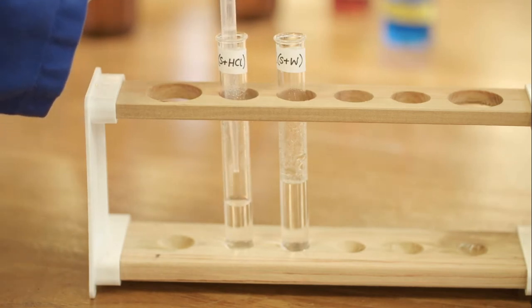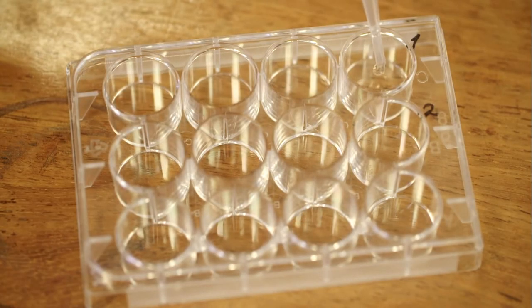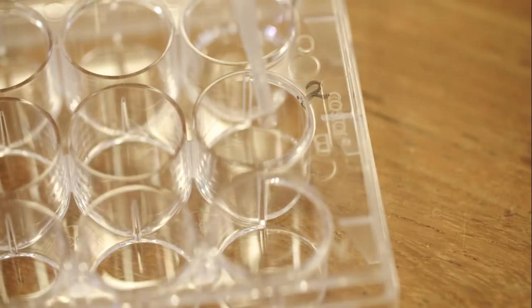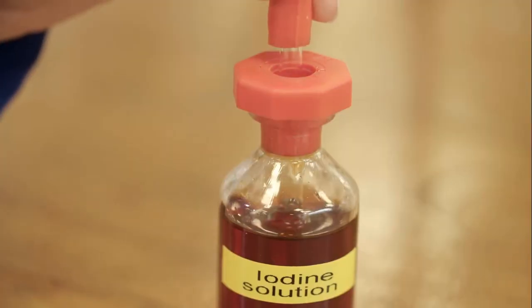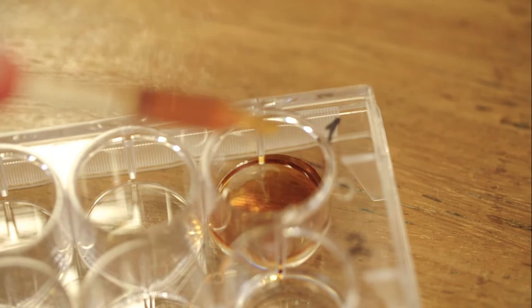Iodine solution is used to test for starch. A small amount of liquid from each test tube is transferred using a pipette to an individual dimple in the dimple tray. Then 5 drops of the brown iodine solution is added to each and the colour recorded.